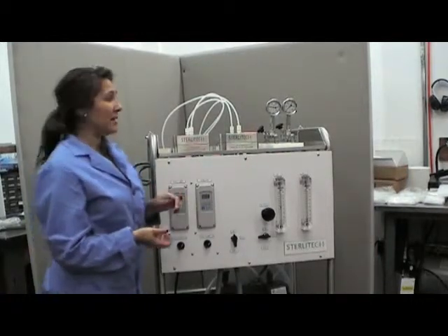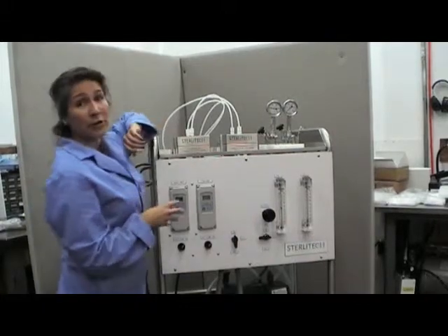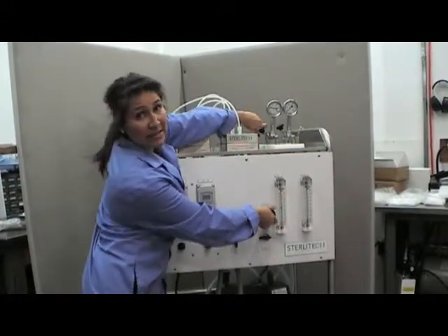Once you finish your experiment and want to release the pressure from the system you'll need to fully open the valves by turning both to the left.